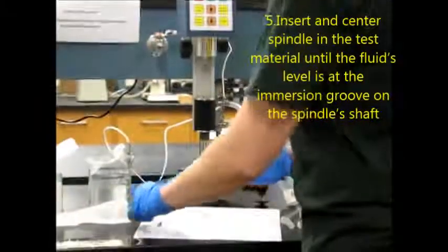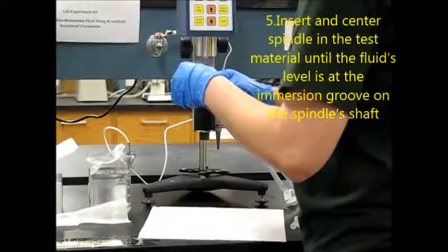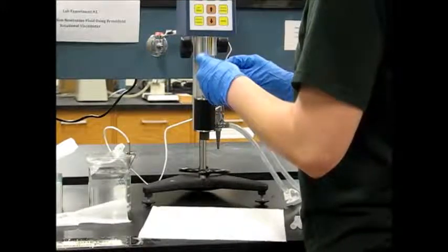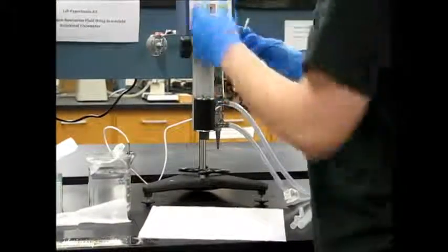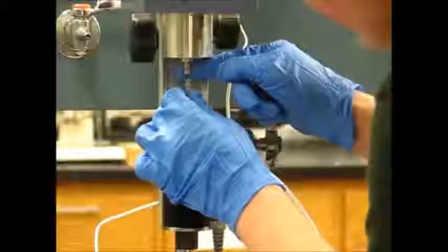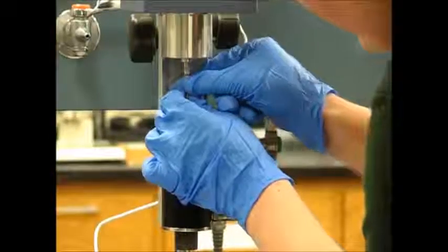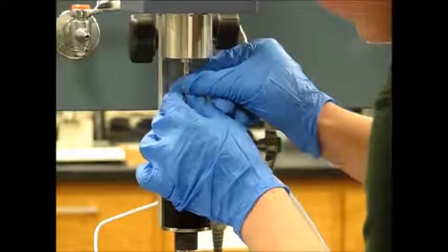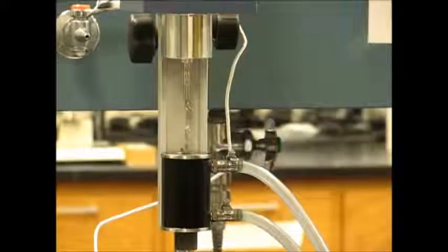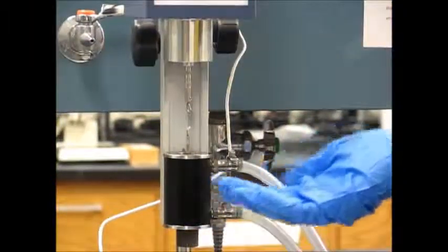Then we're going to take our spindle and slowly place it in the sample container. We're going to attach our spindle to the viscometer, tightening in a clockwise motion. Make sure that your spindle is fully submerged in the polymer solution before continuing.